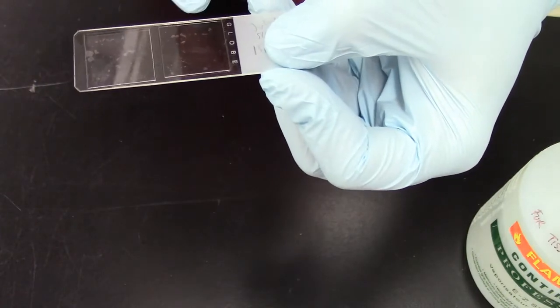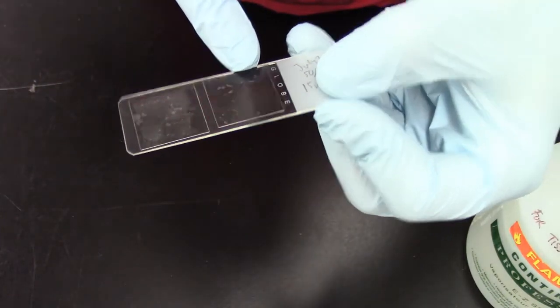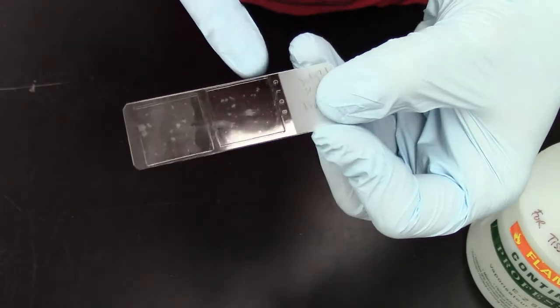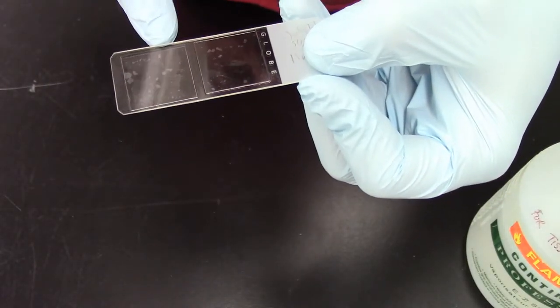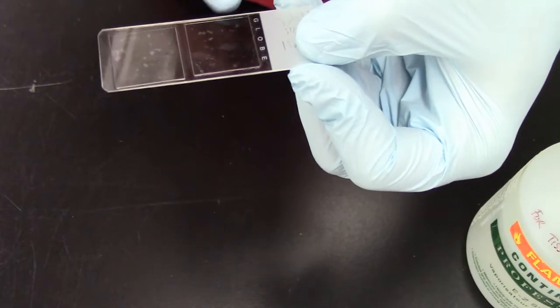So right away you can see that this coverslip I just cleaned very briefly. And this one I did not clean. So you can see right away the difference between them. Now keep in mind that this is not fully cleaned just yet. So this was just one pass.